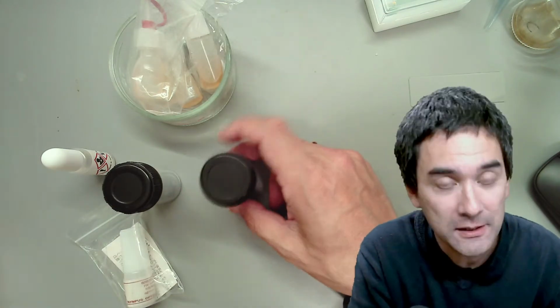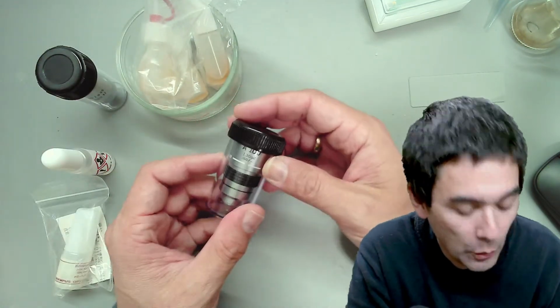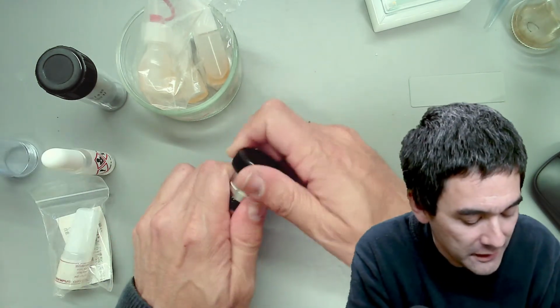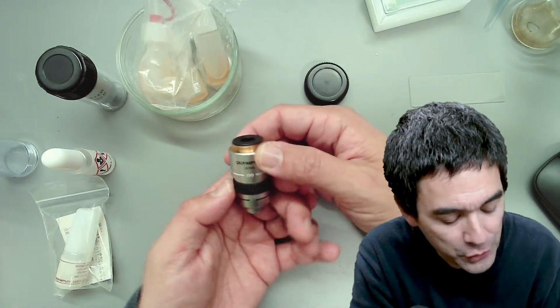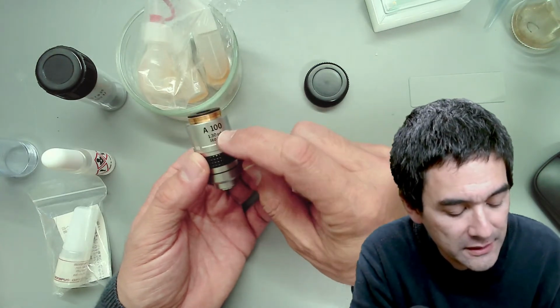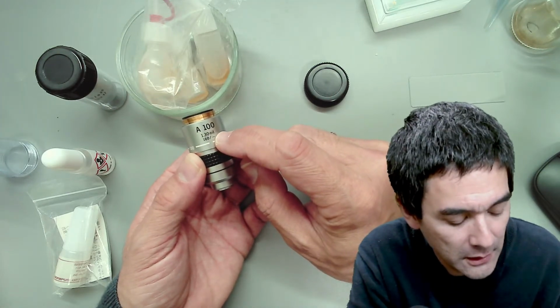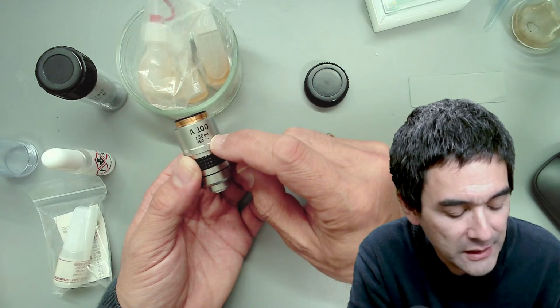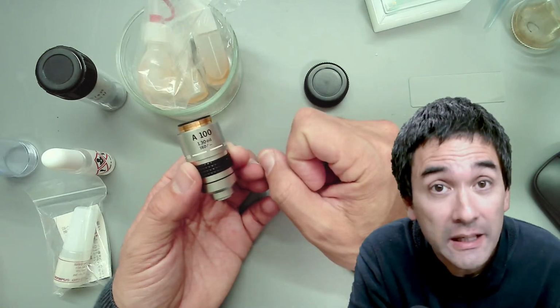So what I have is the following here. I've brought along, simply because it's easier for me to demonstrate, an oil immersion objective. There are a couple of important things that I would like to say here. This is an Olympus from my first microscope that I had. It's a nice objective, and when you look at it, you're going to see that it's the 100 times magnification objective, and there's the word oil written on it. And that is very important. You can only use oil immersion microscopy using an oil immersion objective, and if you don't use the right objective, you might actually end up damaging the objective.